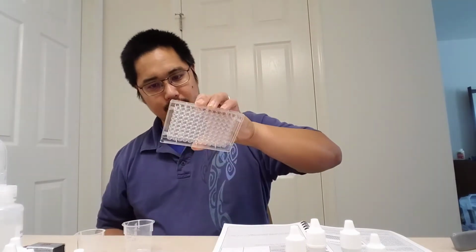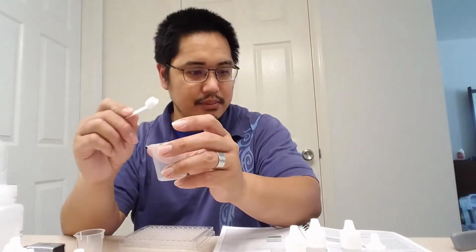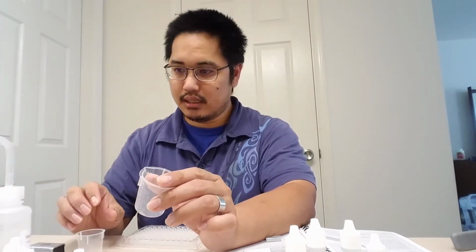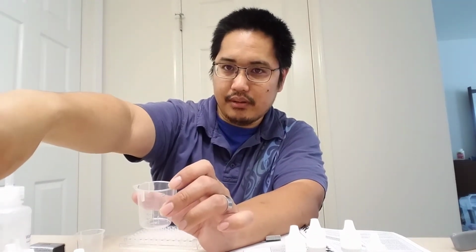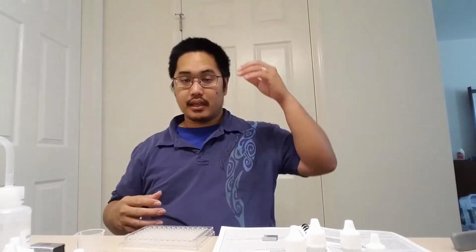This lab is pretty simple to set up. What we want to do is first make our table sugar mixture, and to be honest with you, I forgot to grab the table sugar downstairs, but use this. You mix it up with 2 spoonfuls, and then you put 60 milliliters of water in there. Actually, wait a second. I probably want to use my 150 ml one, the bigger cup. It's currently being used with something else, so I'm not going to use that for now, but you want to put 60 milliliters of water inside there. Mix it up, and that will be your solution.